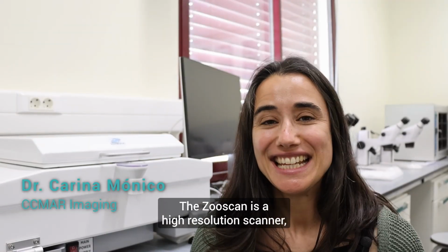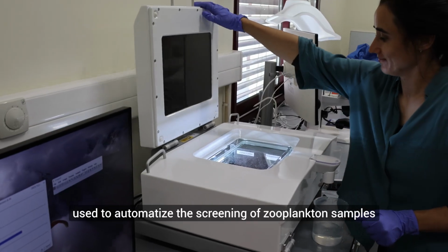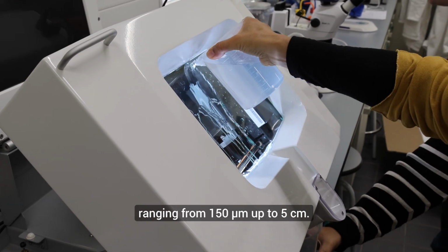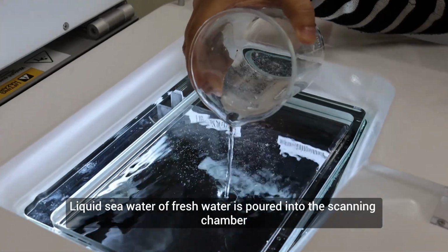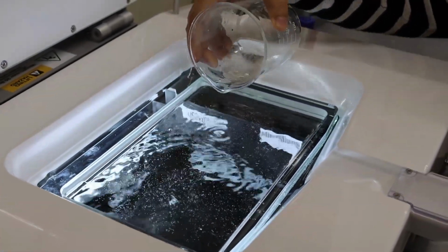The ZooSCAN is a high-resolution scanner used to automatize the screening of zooplankton samples ranging from 150 micrometers up to 5 centimeters. Liquid seawater or fresh water is poured into the scanning chamber, and then the sample just gets scanned as a normal scanner.